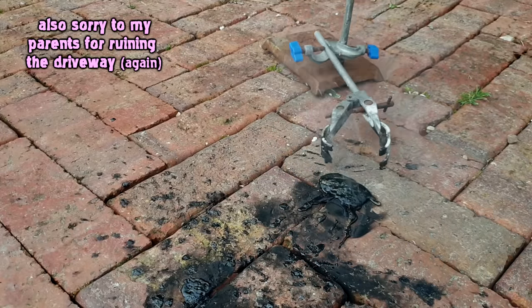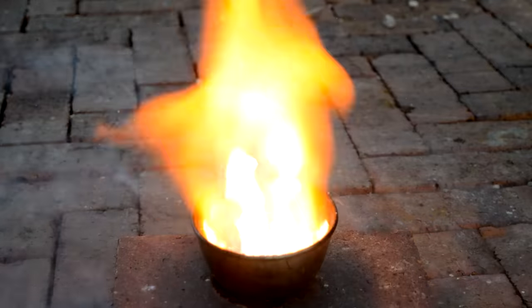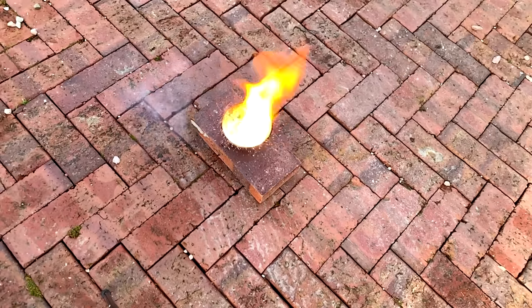We can also add the liquid oxygen to a burning fuel — say let's take isopropanol and we light it on fire. It's not heaps violent because the isopropanol already has some oxygen; it's not actually that oxygen deficient.